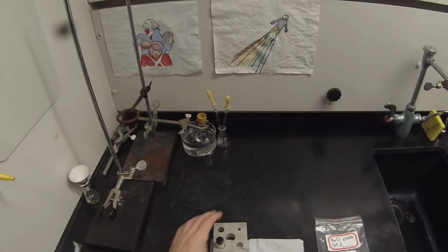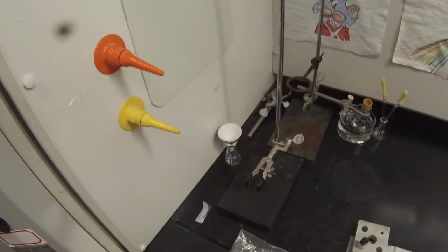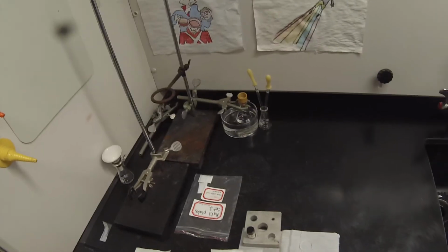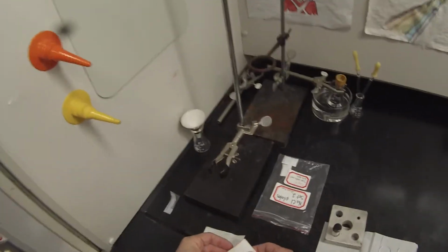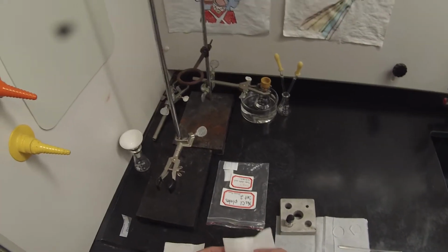So we're going to get an IR on the purified distilled ester. Notice I'm sitting in the hot block, or a block, not the one that was hot, obviously. And I have my set of sodium chloride plates. I've already woken up the IR. So we have one nice plate and one slightly broken plate, but still usable. And then we have one very broken plate that's in here. It's actually a small and quite useless fragment in there as well.